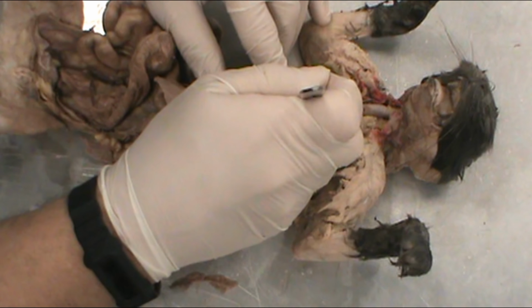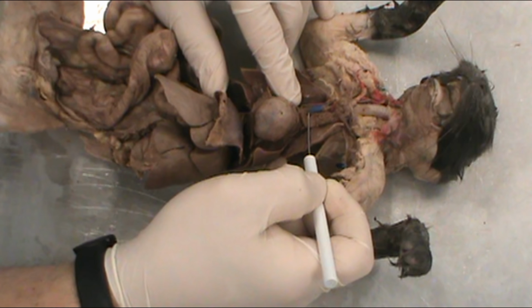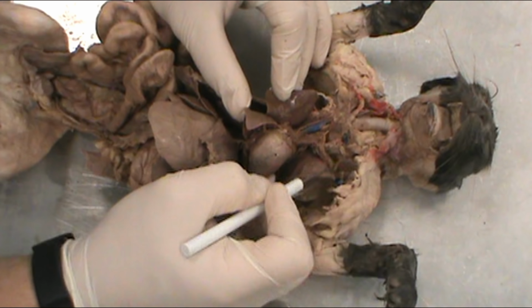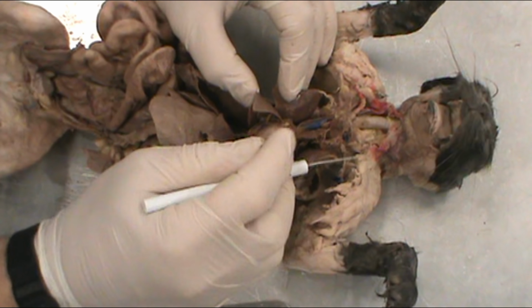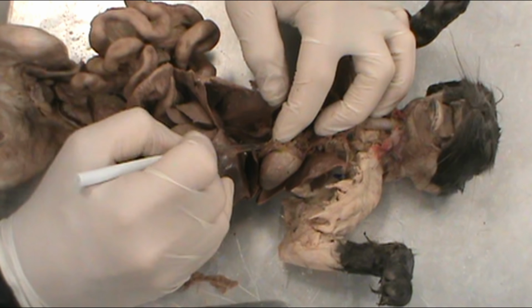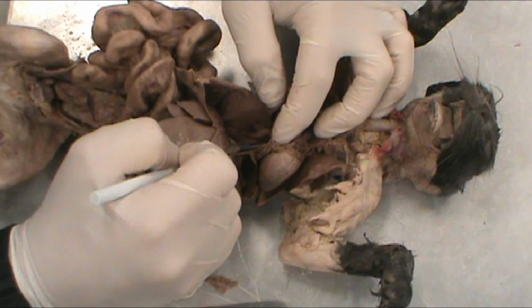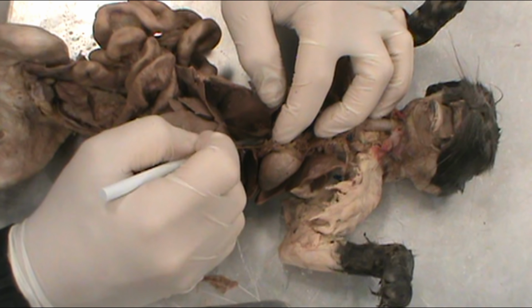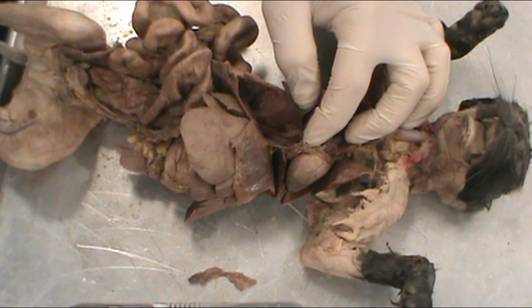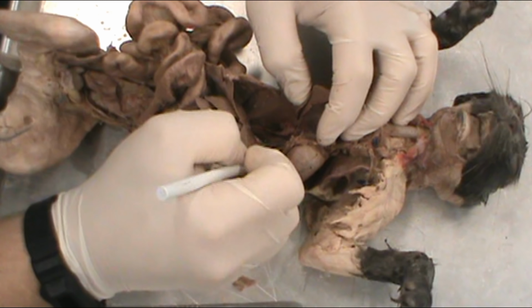So the vena cava, this superior vena cava, would be this large blue tube right here. All right, so we'll tip it to this camera, make sure we get a good look. That would be this blue tube right here. And while we're talking about vena cava, let's come down here to the bottom, and we will find the inferior vena cava, which would be the big blue tube directly underneath the heart down in here. Let me turn this so I can see the screen a little better. There we go.